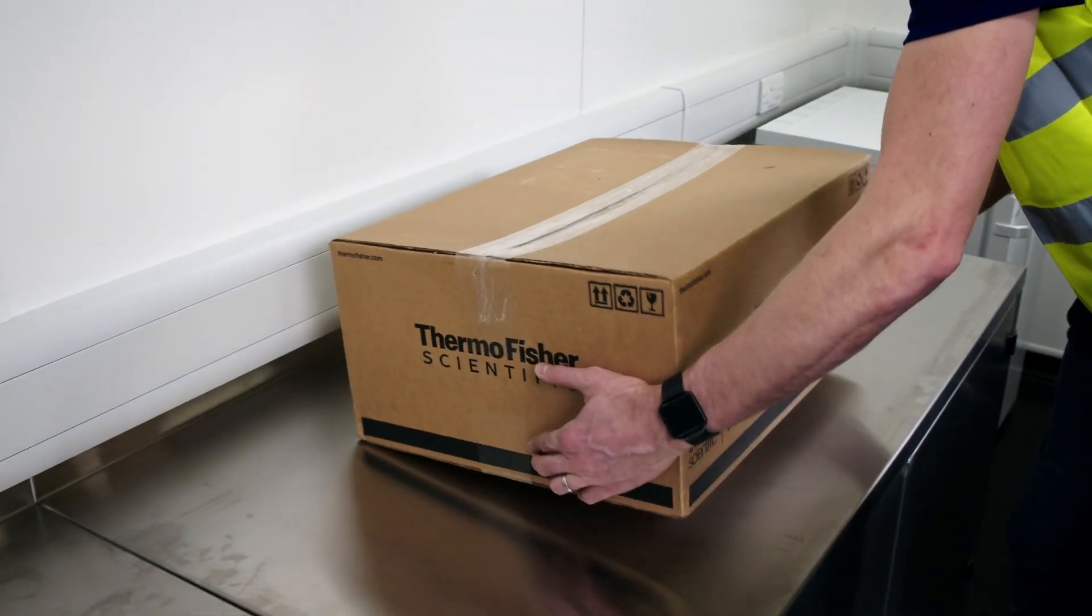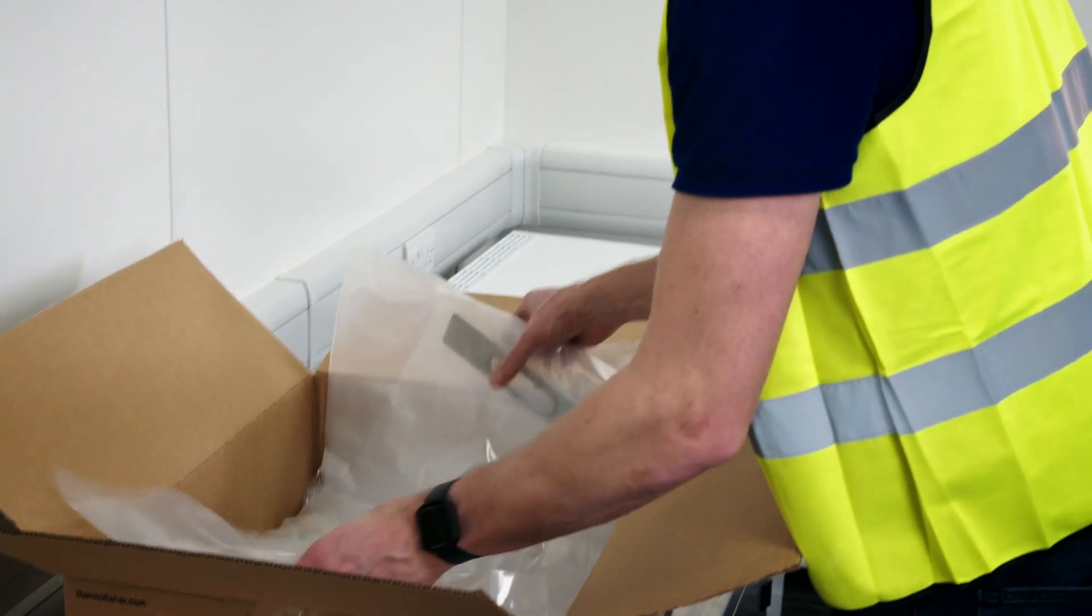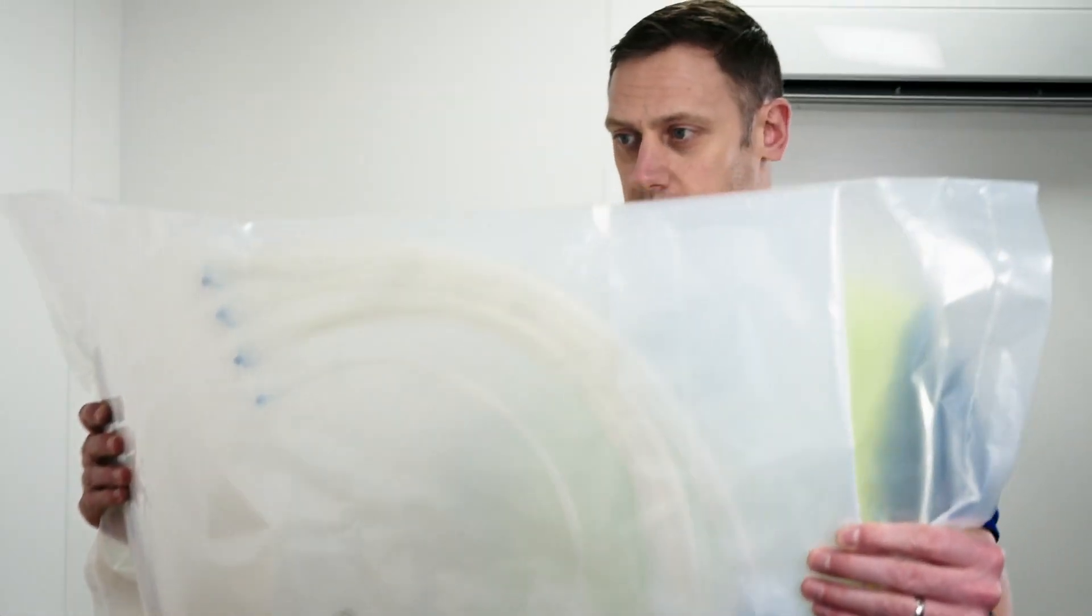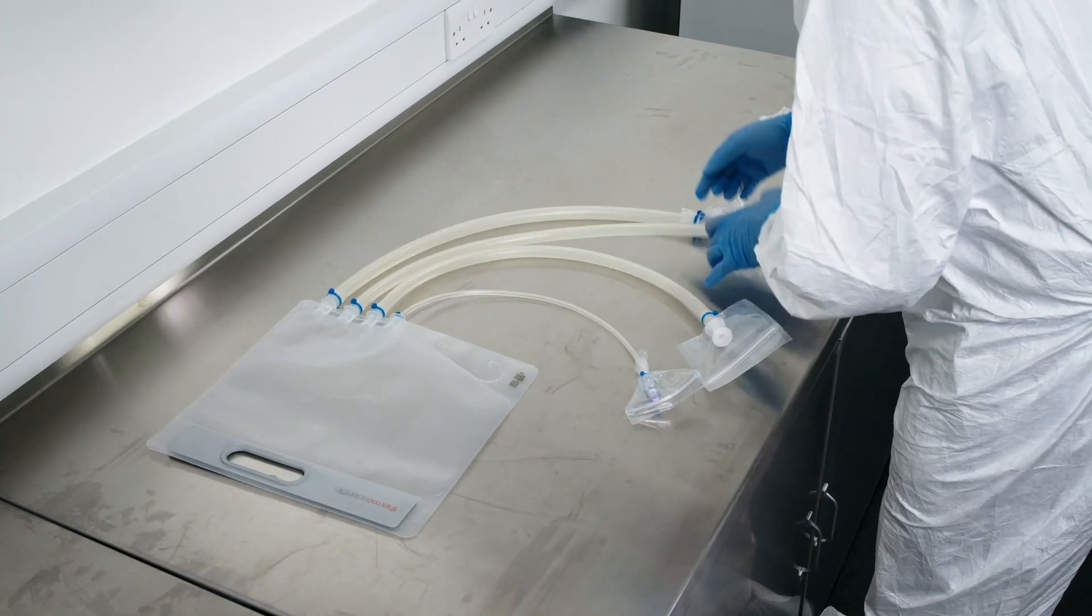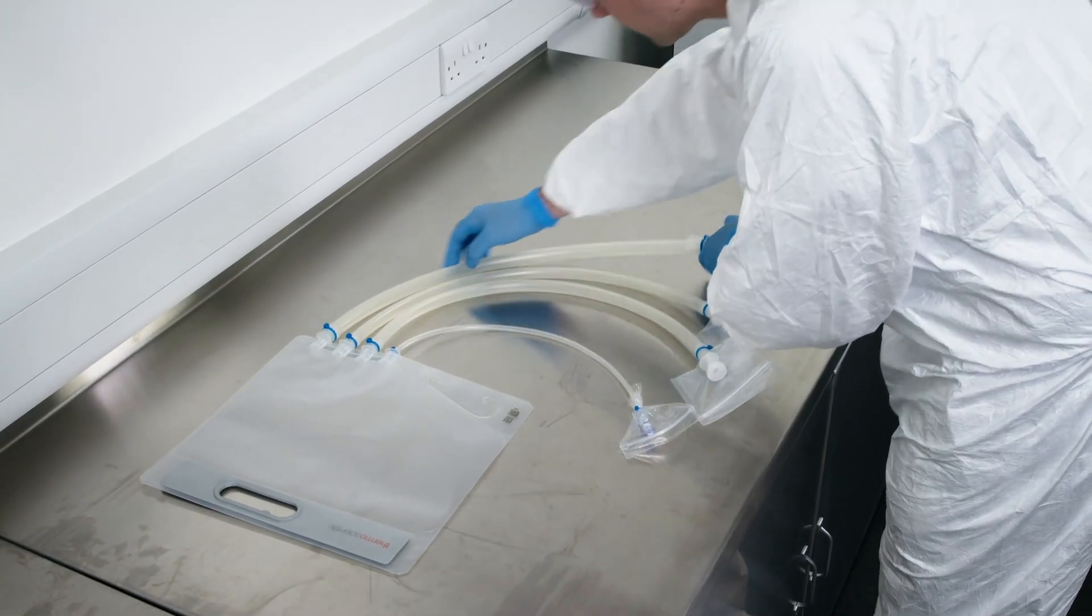This video is part two of two videos that cover the unpacking and inspection of Thermoscientific Bioprocess Containers, including both 2D and 3D BPCs, manifolds, and tubing assemblies.